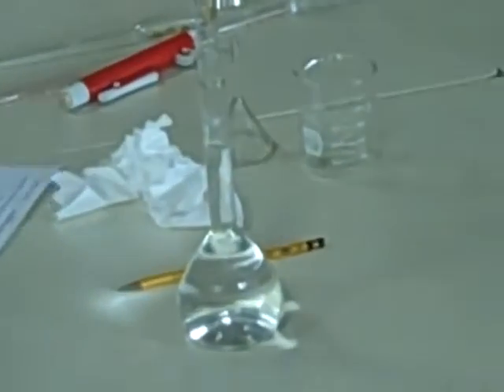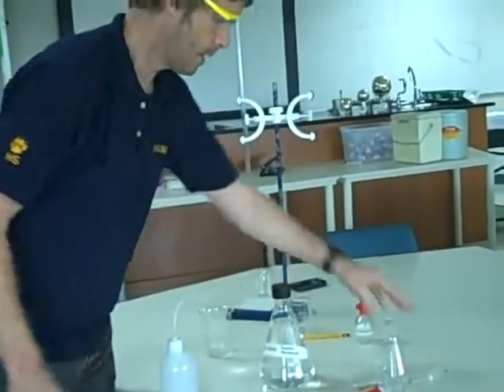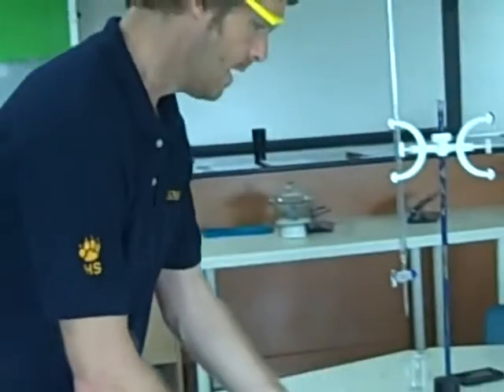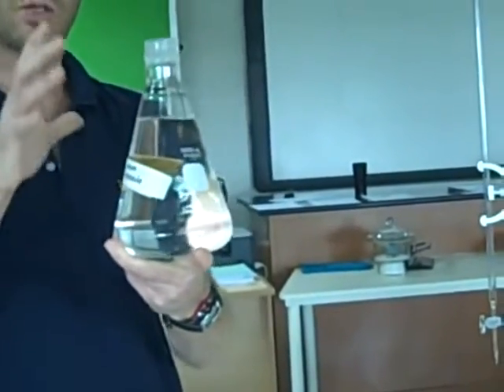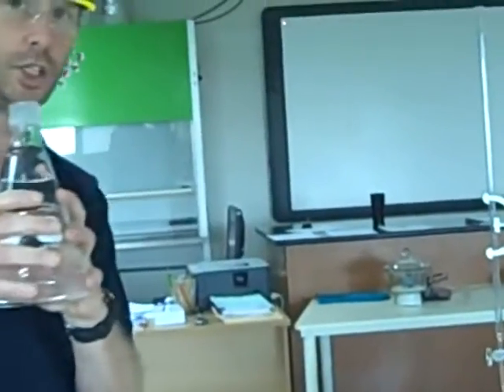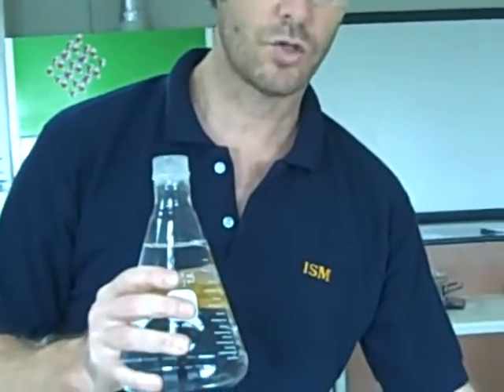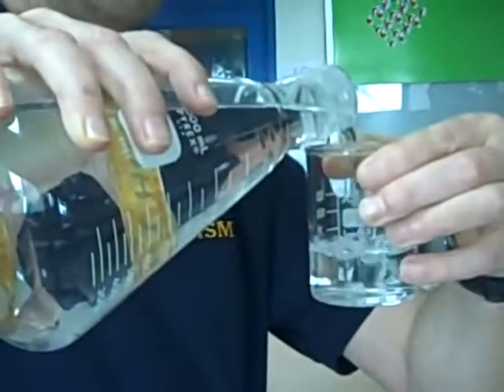It then tells me to pipette 25 cc's of 0.1 molar sodium hydroxide into a conical flask. Here's my conical flask. It's a 250 ml conical flask. And instead of pipetting out of this stock solution, this is my standard solution. This has got a concentration to three decimal places, or three significant figures. Knowing this concentration is going to allow us to find out the concentration of our acid solution. So into my pre-labeled sodium hydroxide beaker with a nice pencil so we can rub it out, I'm going to put in more than my 25 ml. I've got about 100 ml of sodium hydroxide.